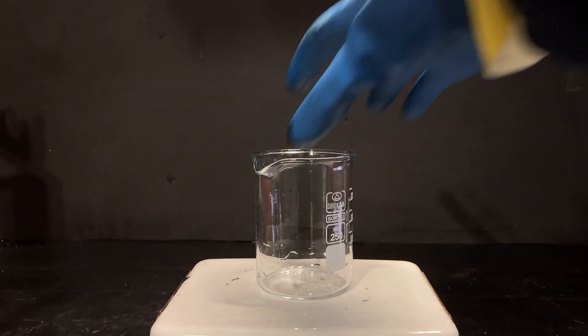Now, I set that to the side and I can now pour in about 30 ml of sulfuric acid with stirring on.